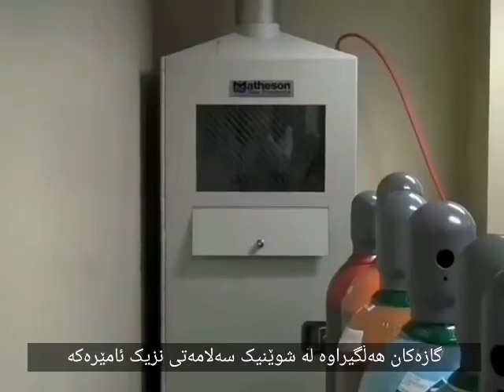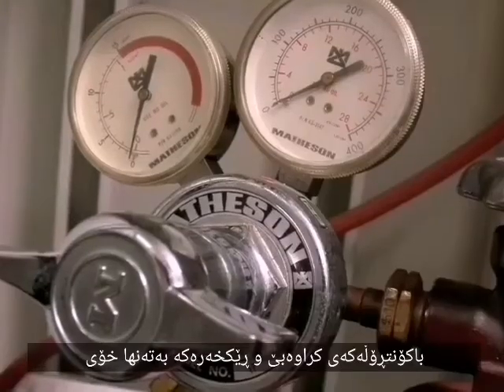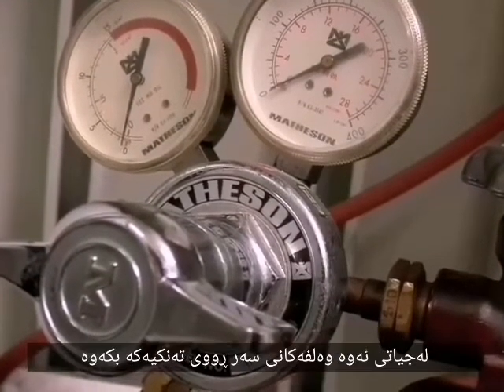The acetylene is housed in a safety closet behind the instrument. You need to turn on the tank. You can access the valve through the small trapdoor in the closet. Leave the control on the regulator itself alone. Instead, turn on the valve on the top of the tank. One half-turn counterclockwise should be sufficient to turn on the gas.